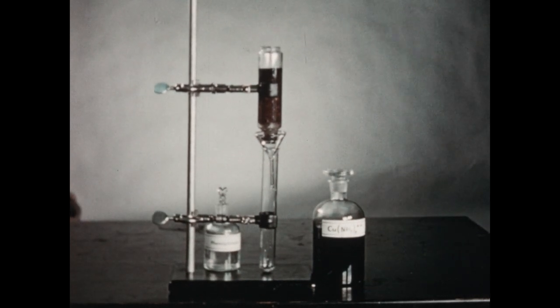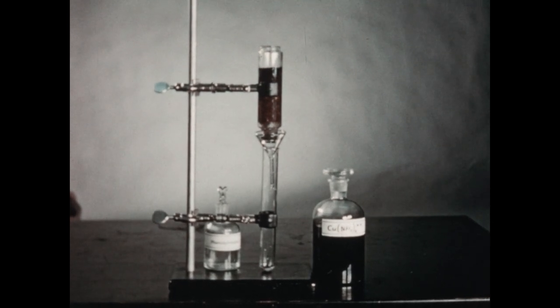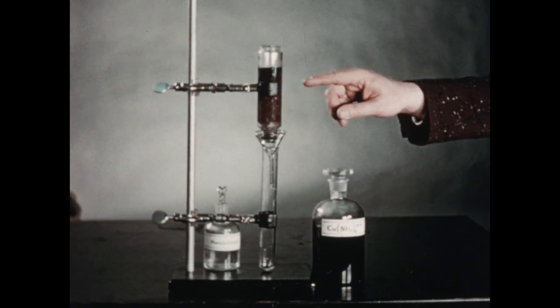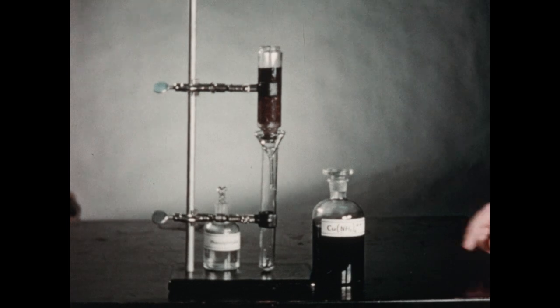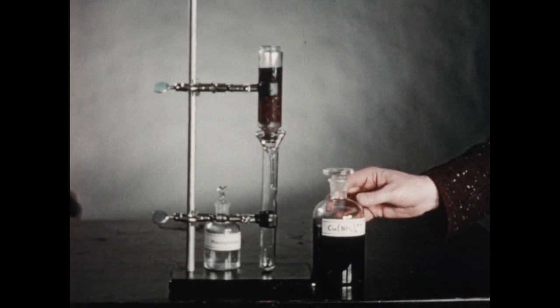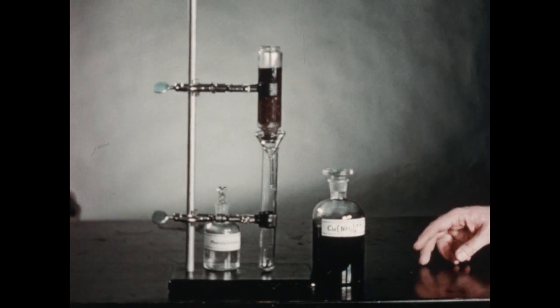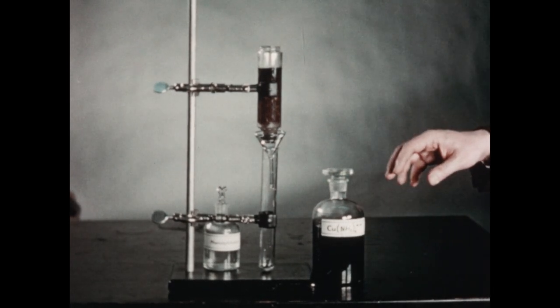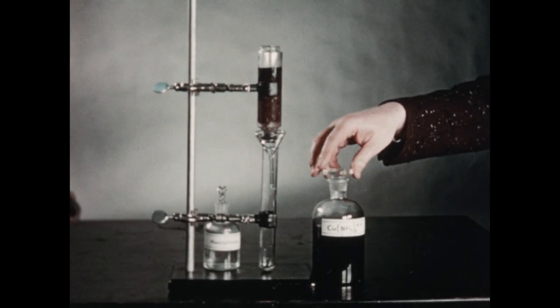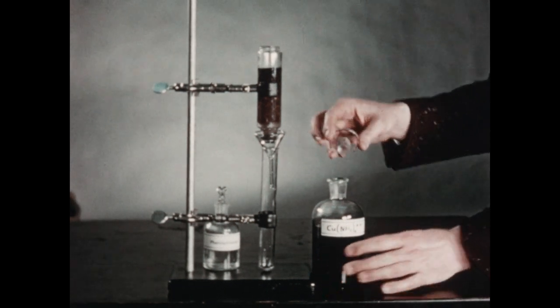As we have just discussed, it's possible to remove offending positive ions from solution using a cation exchange resin. Now, in this tube, we have some cation exchange resin, essentially a sulfonated polystyrene, in which the hydrogen ions on the sulfonic acid groups have been replaced with sodium ions. In this bottle, we have a solution of cupric ammonium sulfate, and the only part that we're interested in is the copper-ammonia complex ion. We're using this ion because of its blue color, which permits us to follow the series of events as they take place.